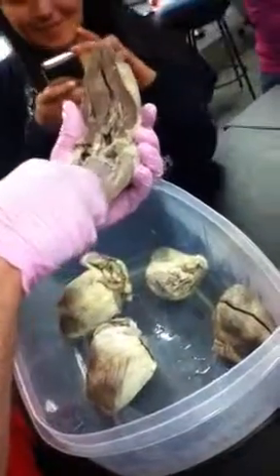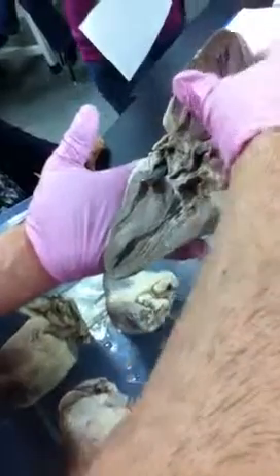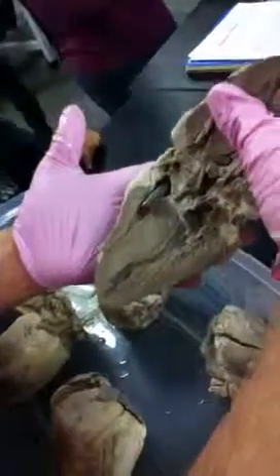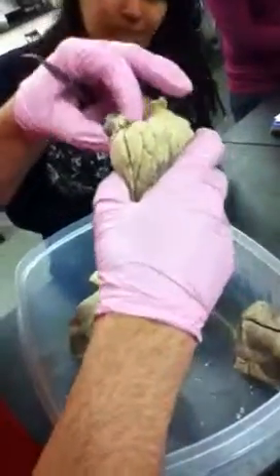So here's a nice picture. You can clearly see this is the right atrium. If I stuck this vessel in here, it's going into the right atrium, superior vena cava, or you could just put vena cava, because we can't really tell if it's superior. You just want to be able to distinguish a right atrium from a right ventricle. And then little auricles, you'll have a little tag on that. Auricles would be these little guys right up here.